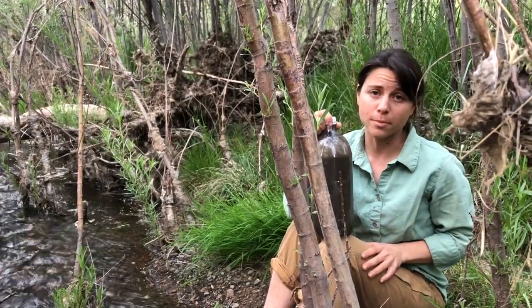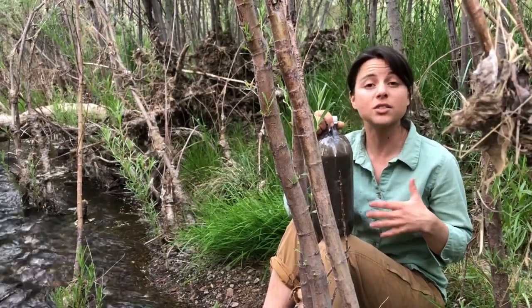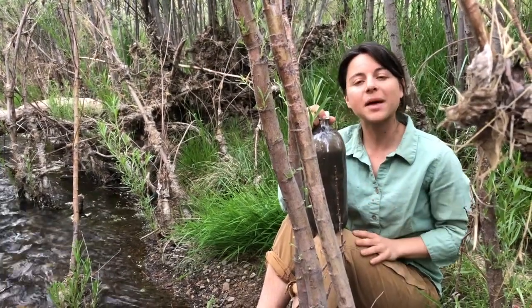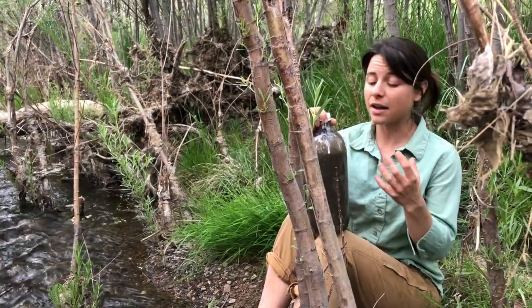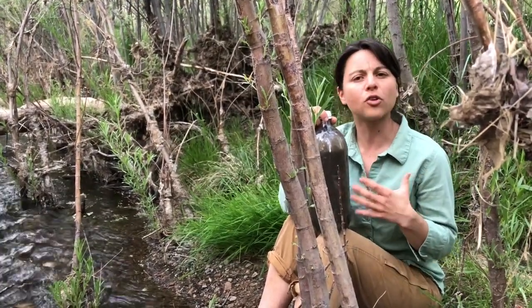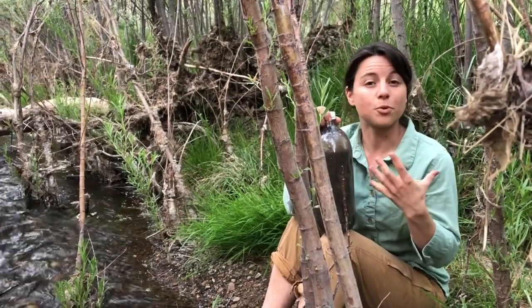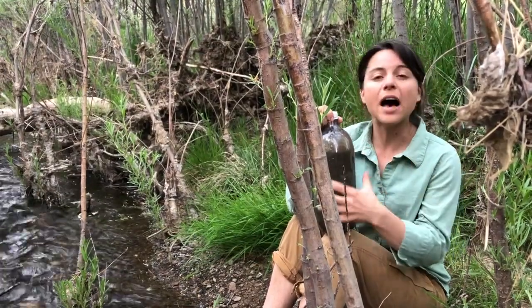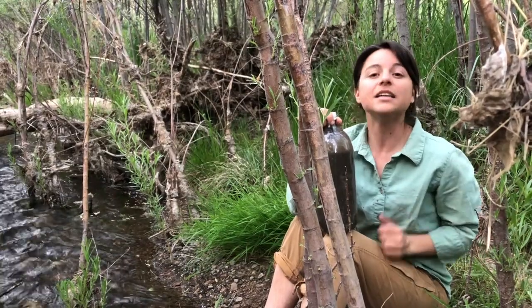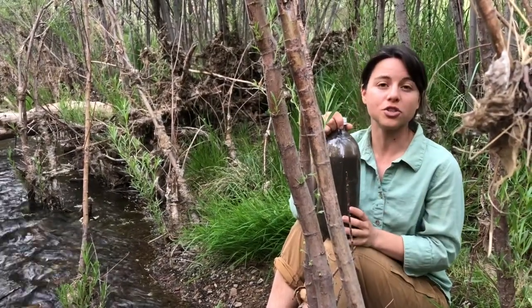This is a long-term experiment. So that means you might not see any biofilms develop for months or even years. However, the long-term nature of this experiment is one of my favorite parts. I've had Winogradsky columns for years of my life. There's some universities that have been growing them for decades. The excitement of seeing the reds or purples or blacks develop and this evidence of these microorganism communities is super exciting. So I will check back with you as mine develops, and I hope you'll do the same.